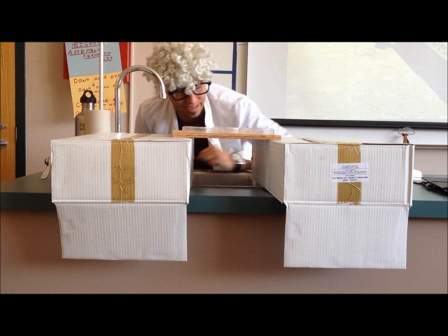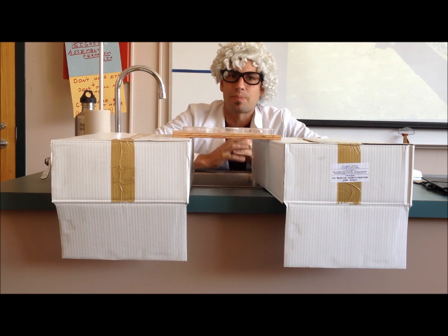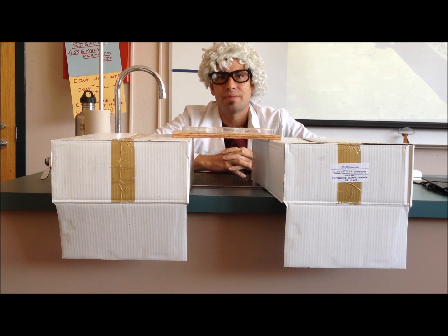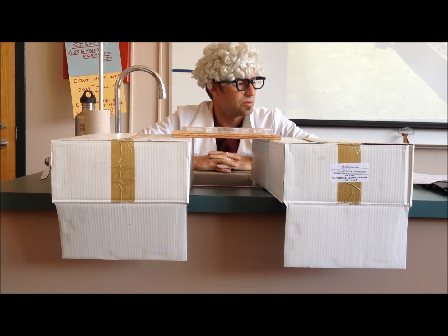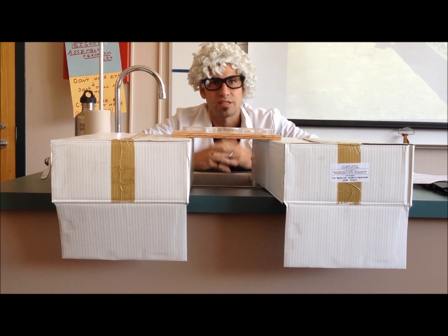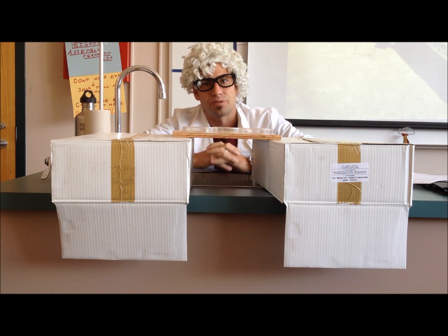Hello. My name is Dr. Rockenbach, and I'm here to give you a little experiment. What is the experiment? Well, in your paper, you will find a spot to write some observations and some inferences. I think I titled this 'Dr. Rockenbach Introduces Petri Dish Magic.' In the observations section, write down everything you observe.